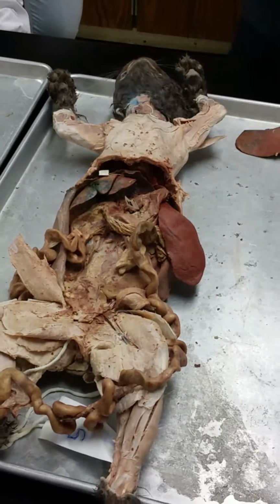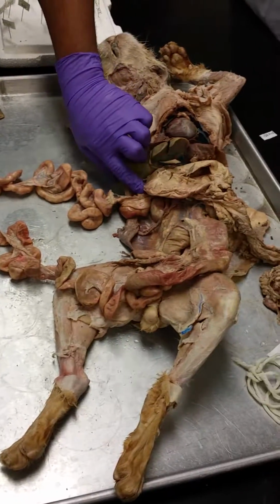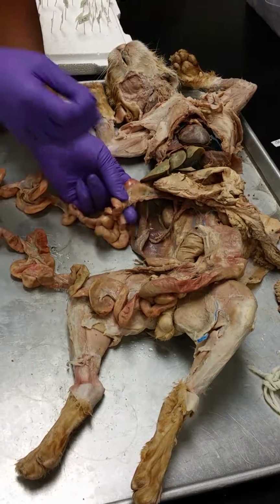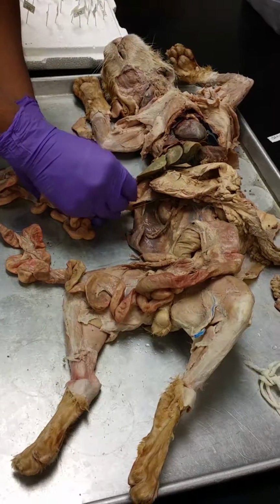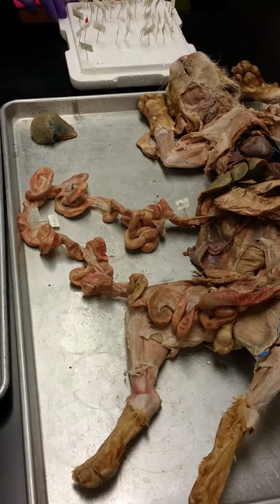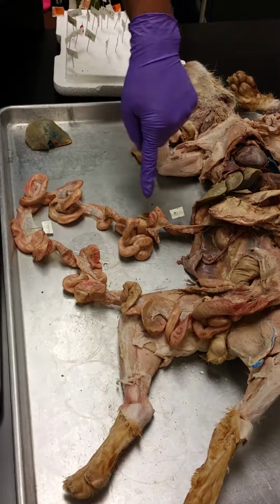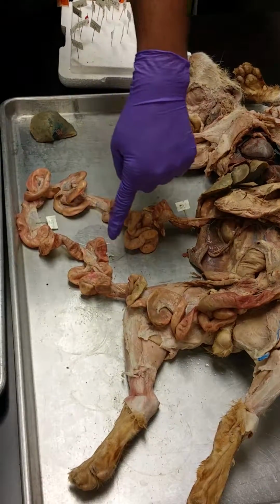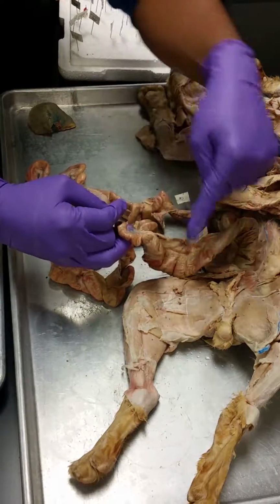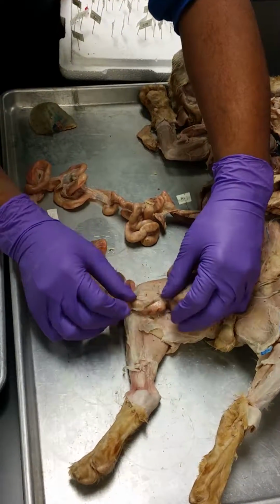Alright, Ocho. Duodenum. Alright, so right after the stomach, the first part of the small intestines. I don't know how long a cat's duodenum is, but we're going to tag it just very close to the stomach. That's got to be the duodenum. Ileum. And then, where's that E, you said? Alright, so we'll use this letter E. Duodenum, the jejunum somewhere in there, but you notice the jejunum's not on the list because I don't want to measure it. And here is obviously the end of the small intestines where it goes from small to large. So we'll tag it close to the large intestines. That's the ileum.